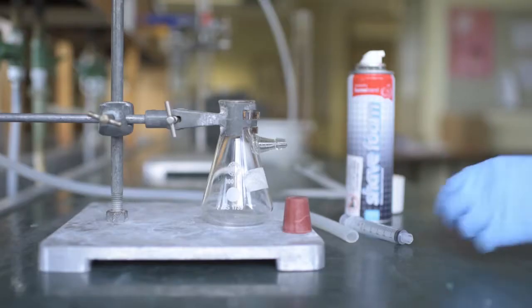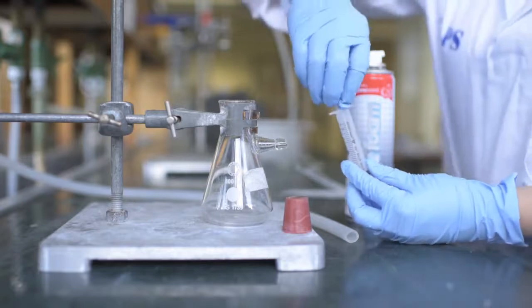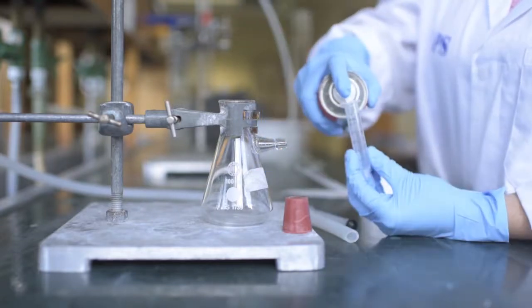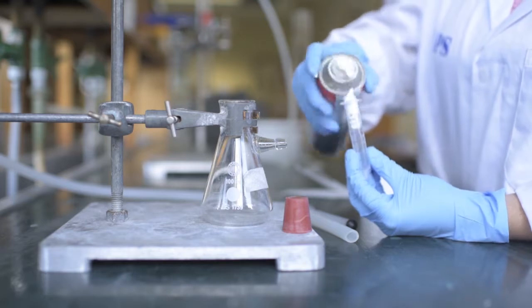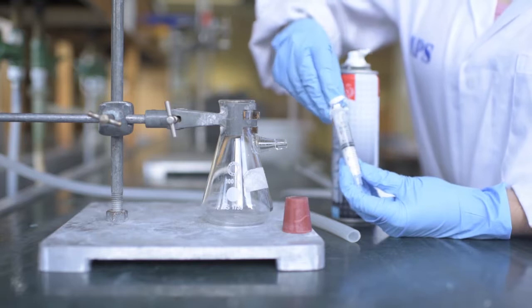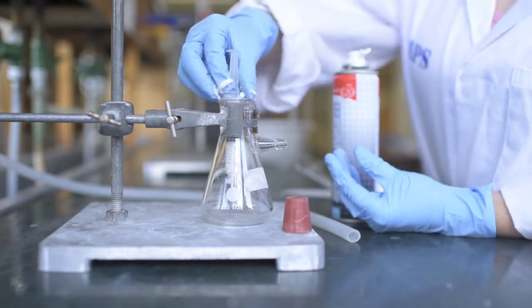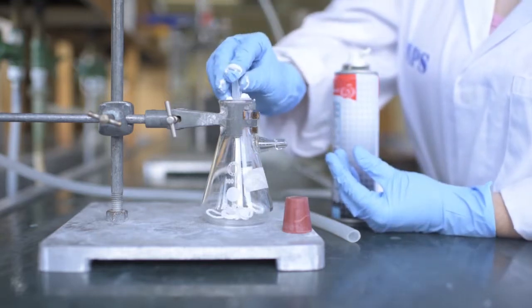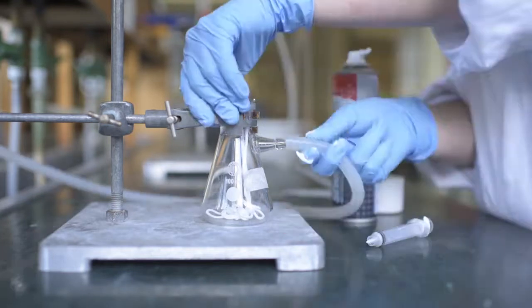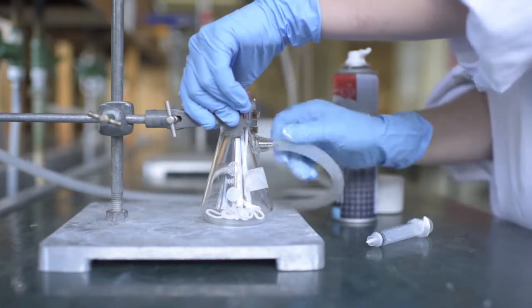To demonstrate Boyle's law, you will be given a 6 ml syringe. Take out the plunger and spray about 2 ml of shaving foam down the barrel. Reinsert the plunger and expel the shaving foam into the bottom of a vacuum flask. Stopper this flask and attach a hose from a water aspirator. Turn on the vacuum when you are ready to observe.